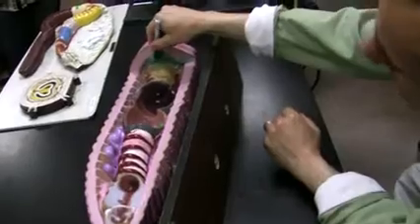Did I show you nephridia? I asked this one. This is nephridia. Intestine, chloragogen on top of it. This is chloragogen on intestine, and this is nephridia.